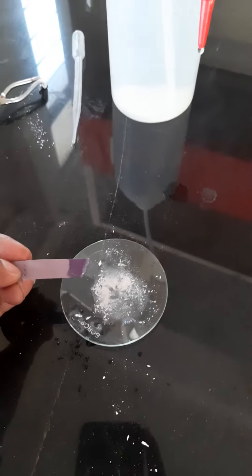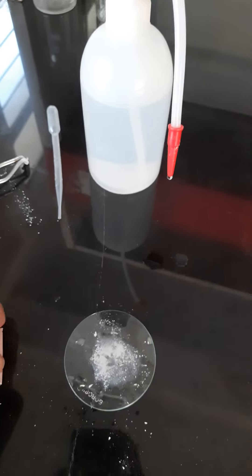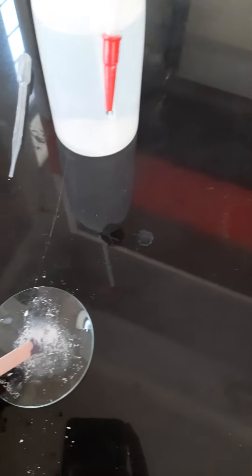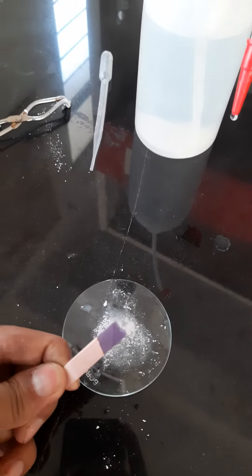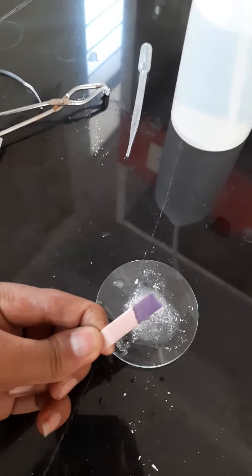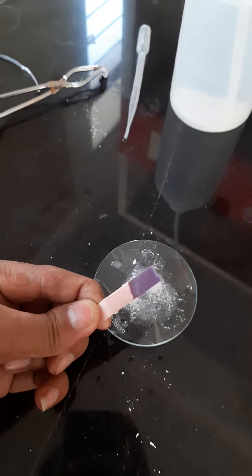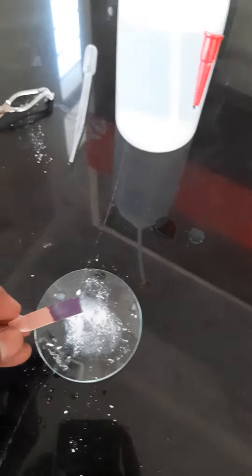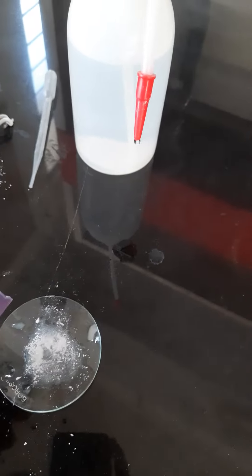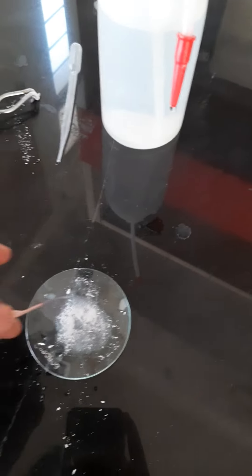I will add the red litmus paper now — let's dip it and check. Yes, the red litmus paper turned blue. This means that magnesium oxide is basic in nature.